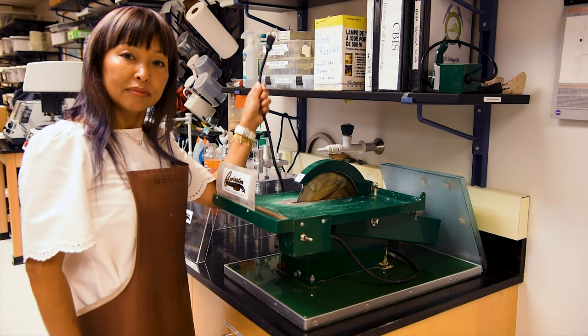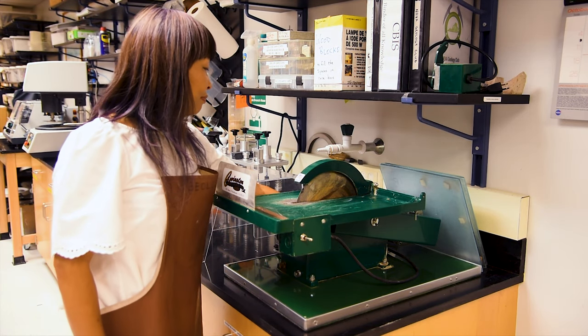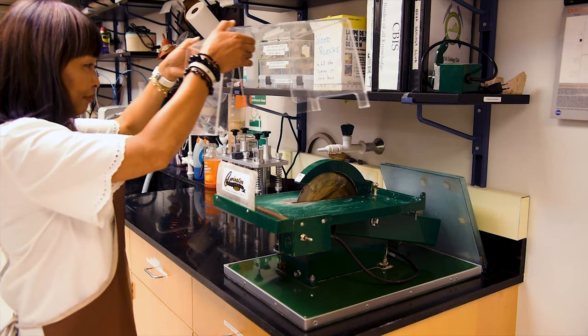When not in use, we keep the trim saw unplugged. The power cord, located here at the back of the saw, will be plugged in when we're ready to cut our rock samples.